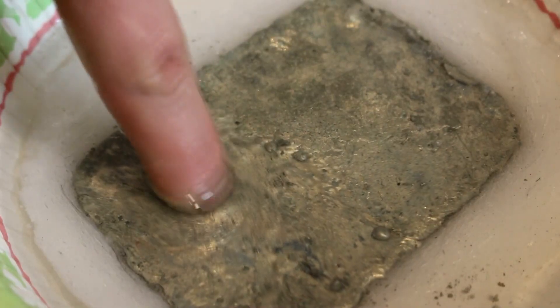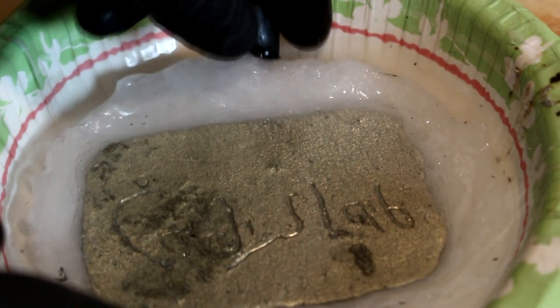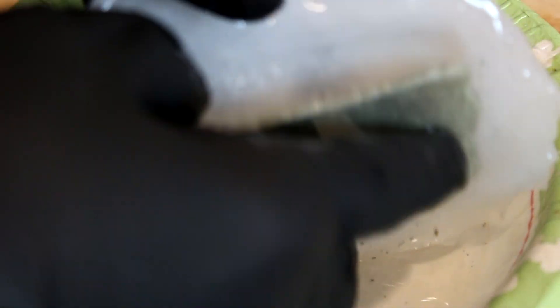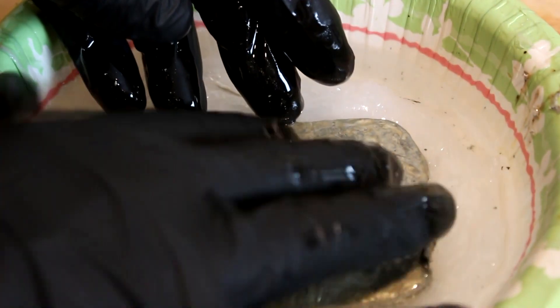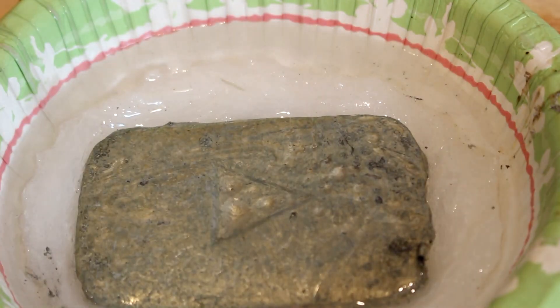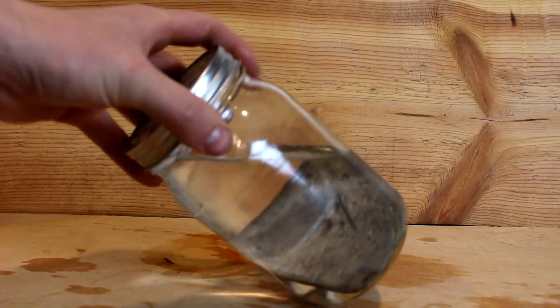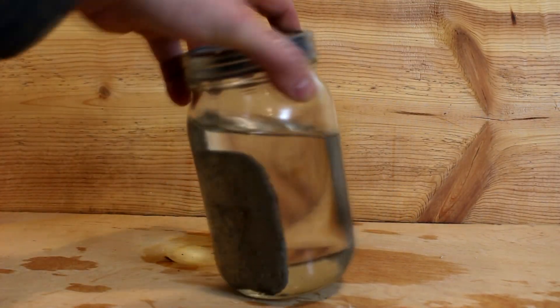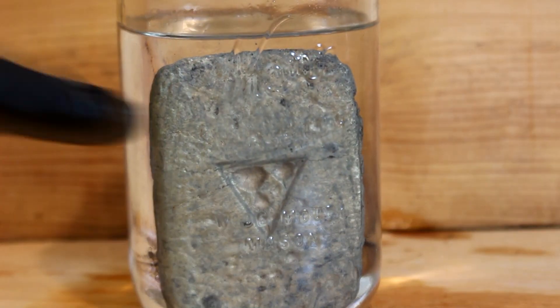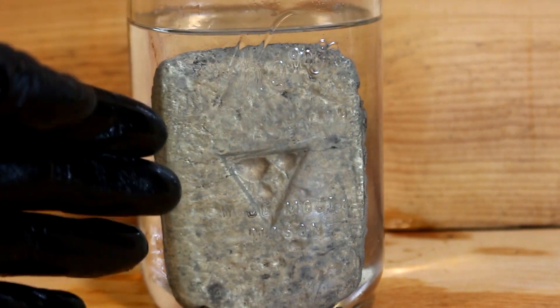There you go — that's a first. So I have repaired it. Let's see if I managed to make the other side any more shiny this time. Hey, I'd say that's better — look at that. Let's keep this coated in oil. I'm going to transfer this over to a jar. There it is. I weighed the jar before and after putting the play button in, and there is 84 grams of cesium. The world's only YouTube play button that is so reactive it must be stored under low-oxygen mineral oil — even baby oil will react with this thing.